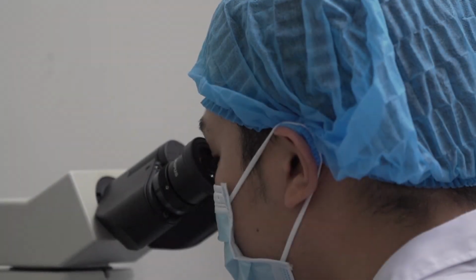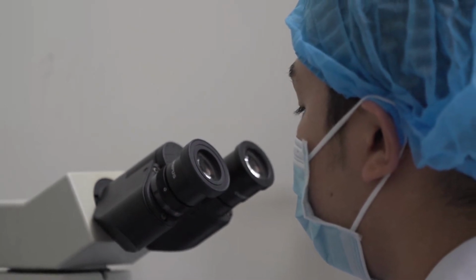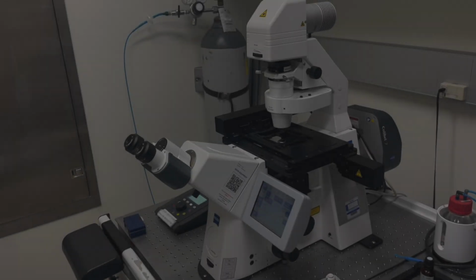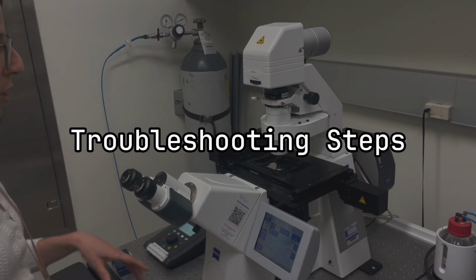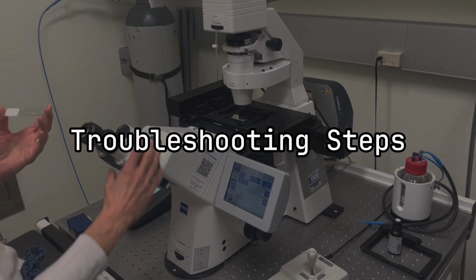This module is designed to ensure that students know the troubleshooting protocols when problems occur in the microscopy lab. After this module, students should know what to do if they're having issues viewing their sample under the microscope or on the computer screen. So, if you're having issues viewing your sample under the microscope, proceed with the following steps.